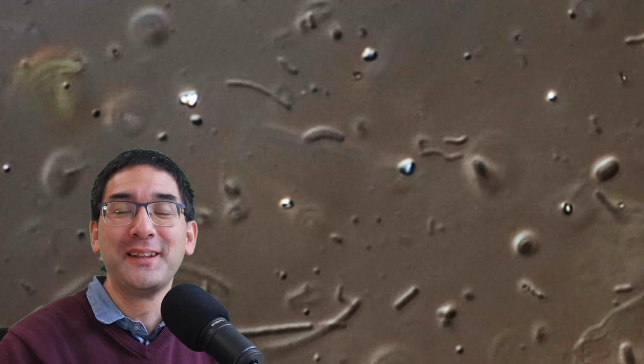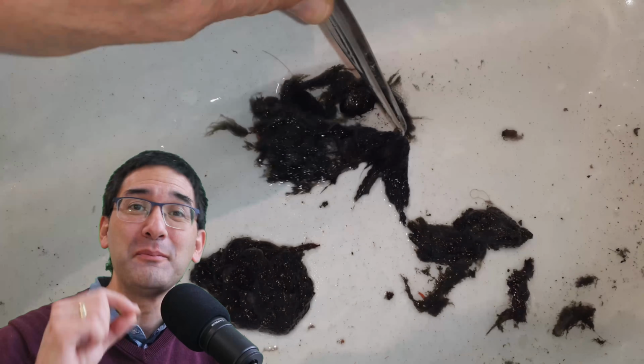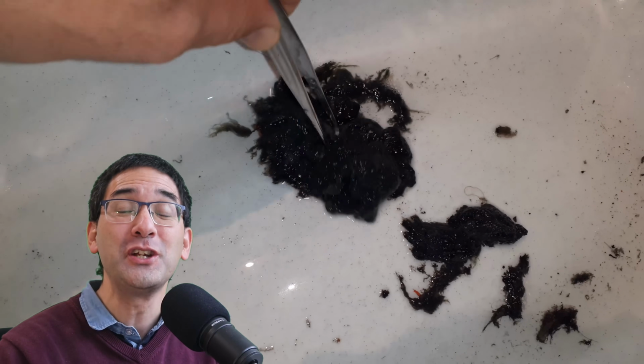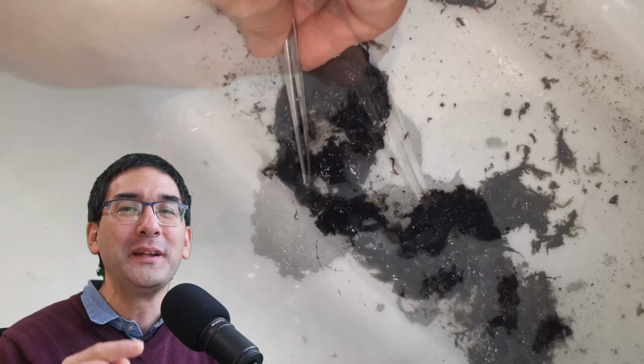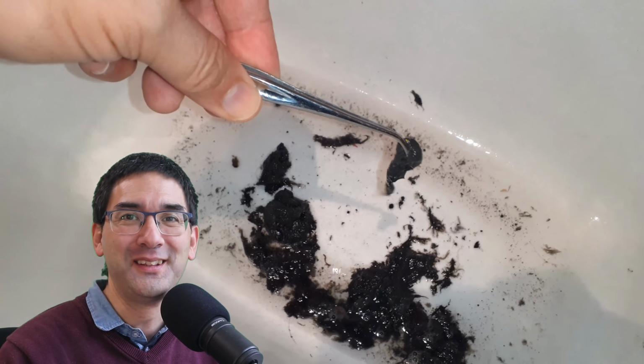Well, where did I find this sludge? You have to watch until the very end of this video and I'm going to show you because I'm certain, I can almost guarantee you that you're able to also find this sludge in your apartment. And at the end of the video I'm also going to show you a little mystery object where I would like to ask you to then guess what the object could be. Also an object that I found in this sludge.